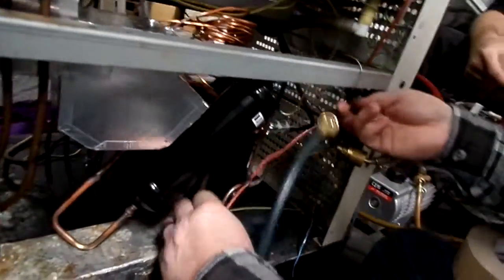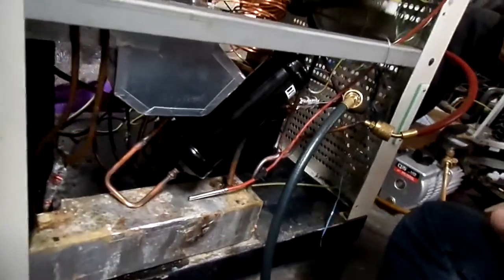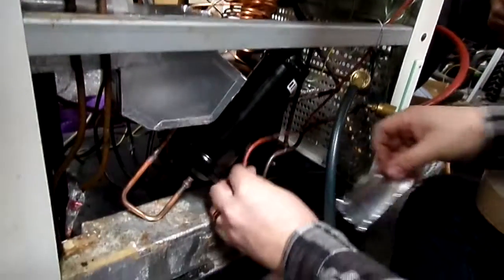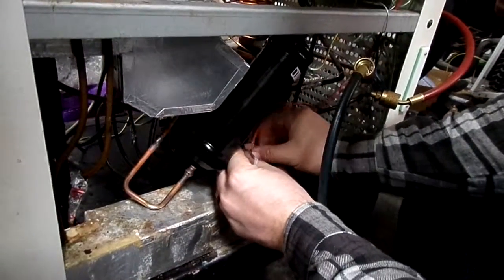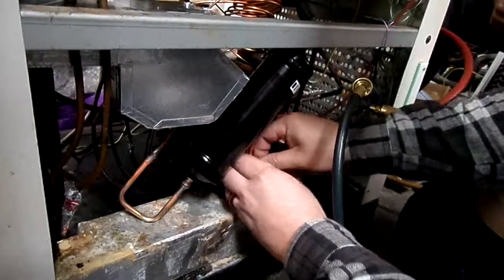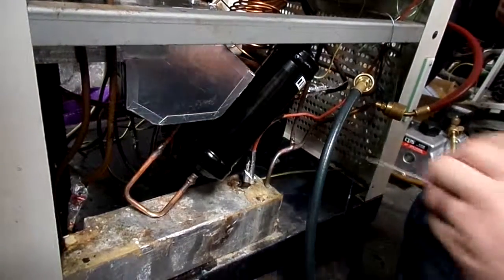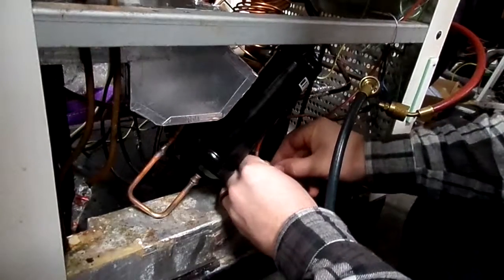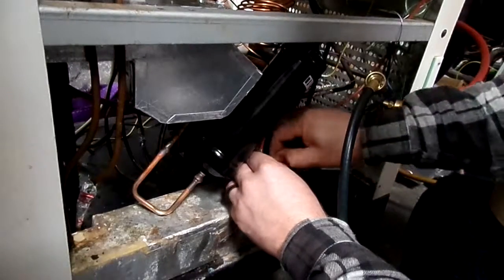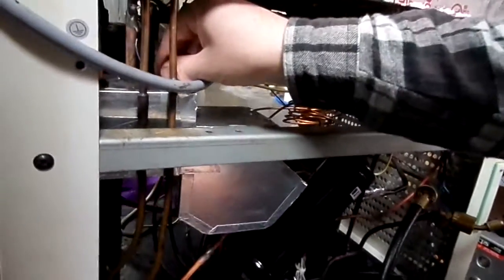Alright, so you got this guy. Goes on the bottom. That's cool. And zip tie. Sensors don't really need more than one zip tie. And you got this little guy up here that goes on.